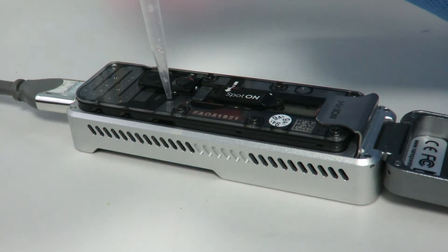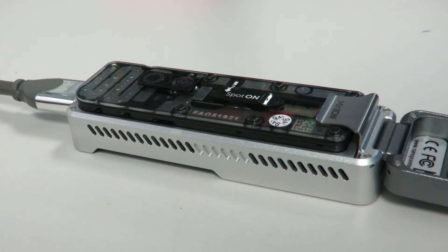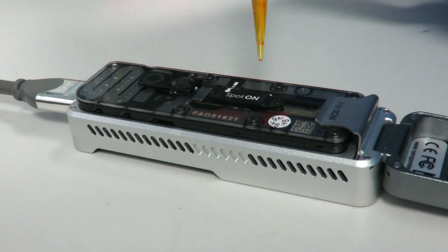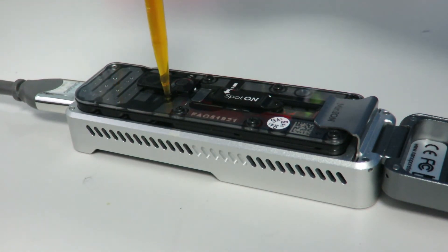Make sure you've got liquid ready. This time you're adding 500 microlitres of the storage buffer, which is yellow. Note: this isn't actually storage buffer — I don't want to waste it — so this is food dye, which may be a little more yellow than usual, but it's the same principle. You put your blob on and then gently load it — you should see it start to go yellow as you push it through. Load your 500 microlitres into the flow cell.